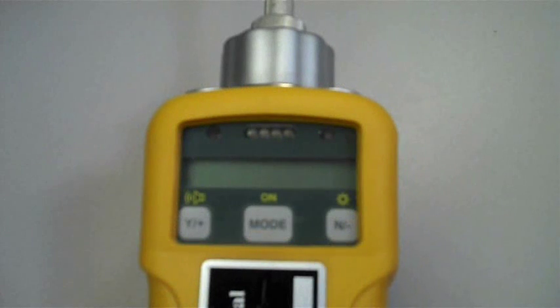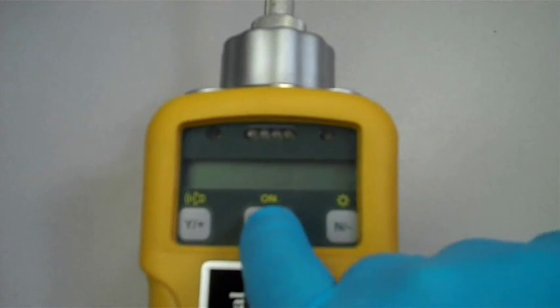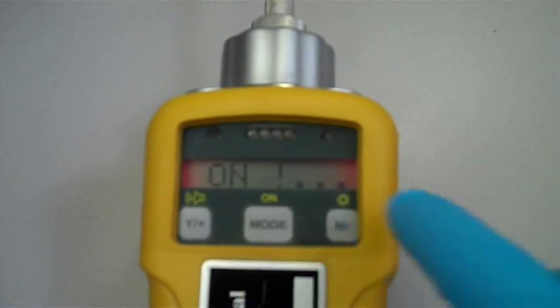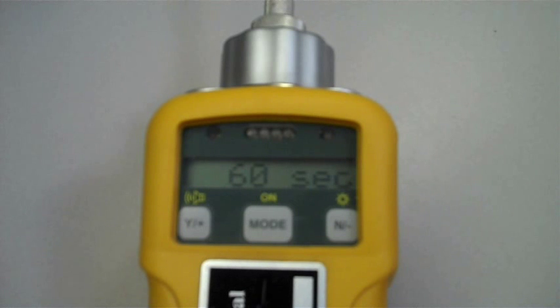To begin, the unit is turned on by pressing and holding the Mode button. The unit will cycle through its warm-up process for about a minute. We will fast forward through this for the purposes of this video. Once the unit displays a reading, it is ready.